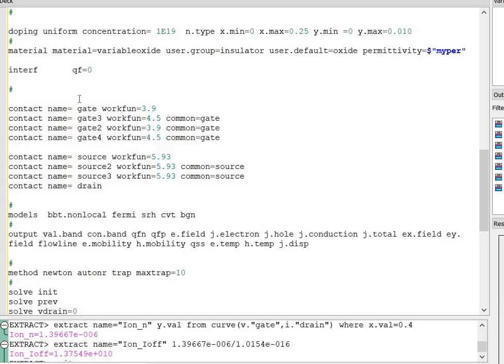Next is the interface statement. I have taken the charge density 0. Next, I have defined the contact name. In case of charged plasma, I have taken the different gate material with work function of 3.9 and 4.5. The source work function is again 5.93 to obtain the doping of 10 raised to power 20. And no work function is used at the drain end because it has high doping equal to 10 raised to power 19.